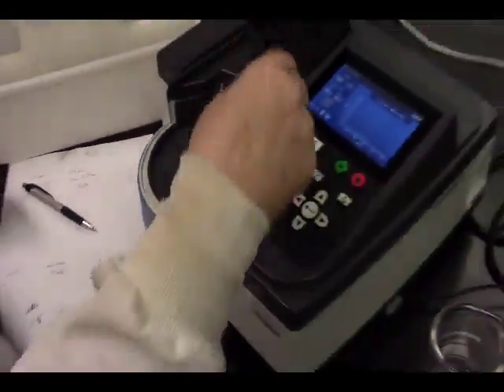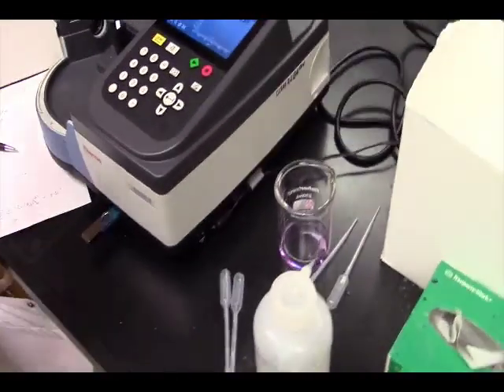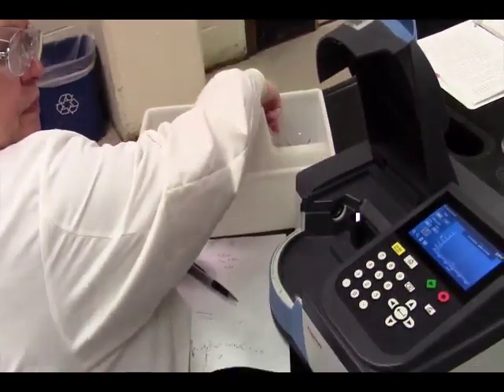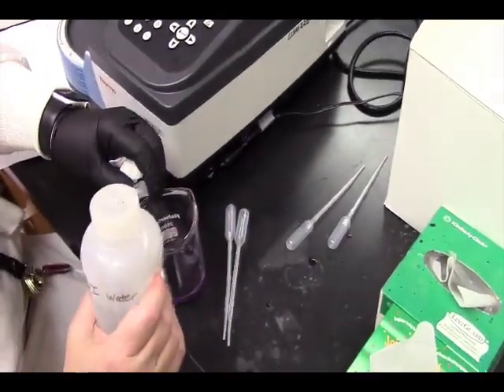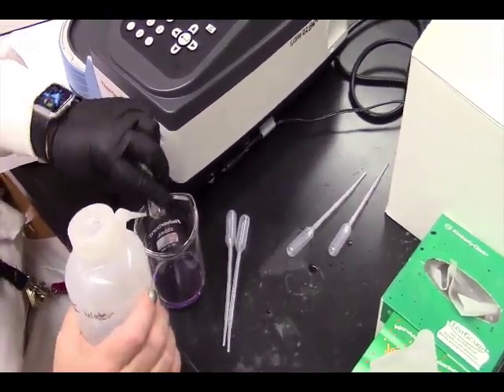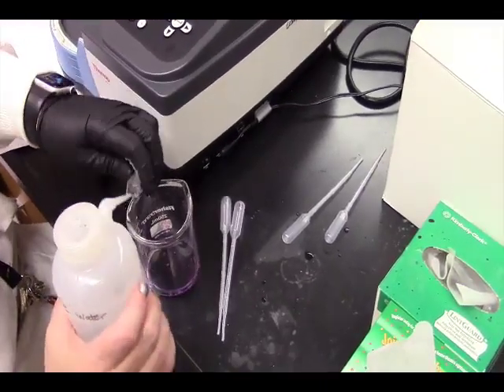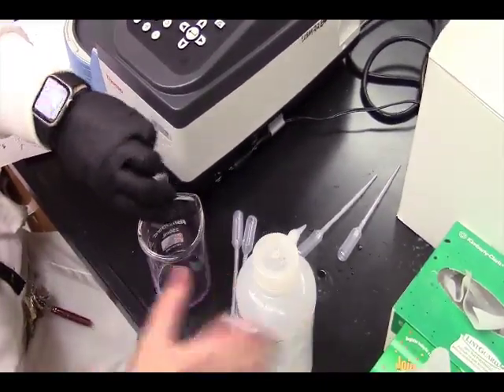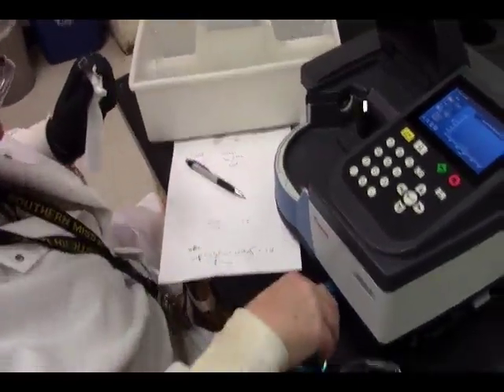We just want our lambda max because you'll need to explain why the cobalt, because remember this is all cobalt. And what gives the colors in our complexes is typically the metal and the different electronic states that the metal is in. And so you're going to need to explain or talk about why there's such a difference in colors with the cobalt.